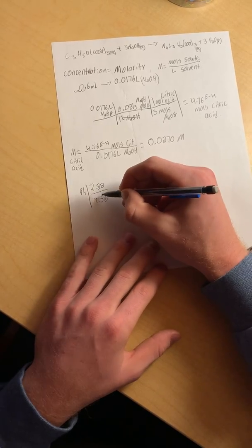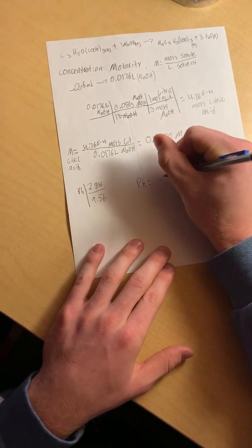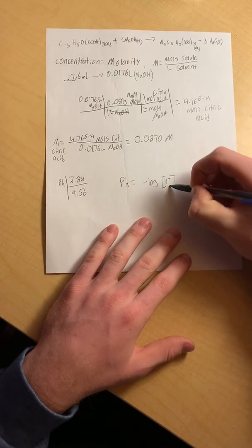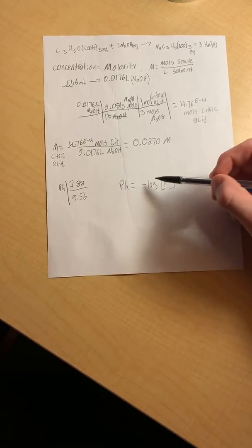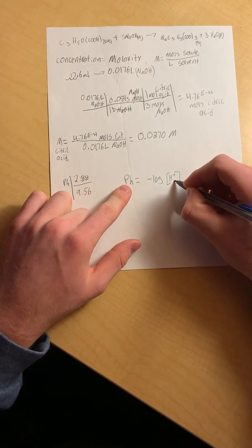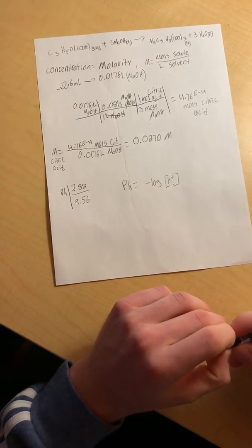We see an increase of almost seven on the pH scale. The way we determine pH mathematically is: pH equals the negative log of the concentration of hydrogen ions in the solution. Whatever the concentration of hydrogen ions goes into this formula. I used the lab manual provided in class as a source for the procedure. Thank you, and I hope you enjoy it.